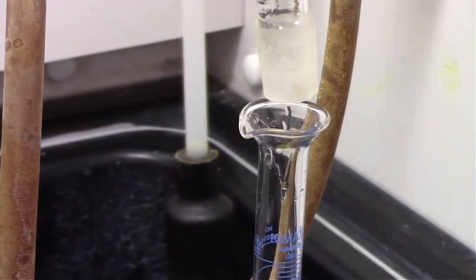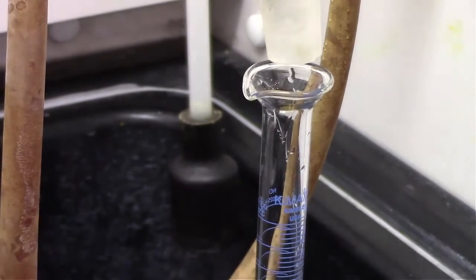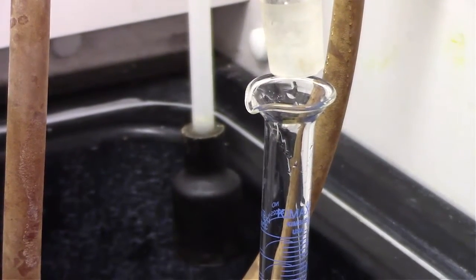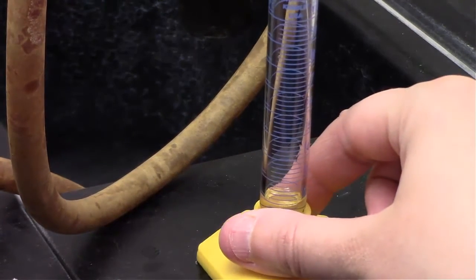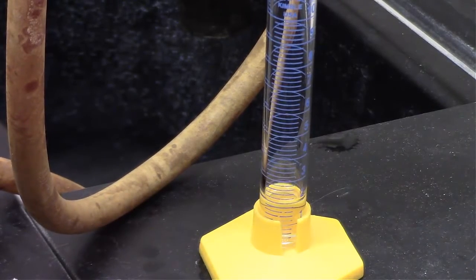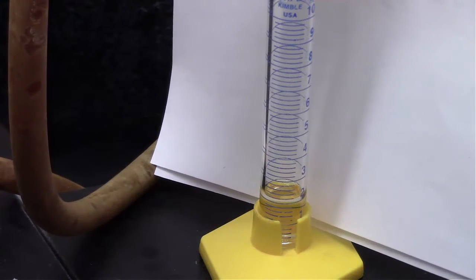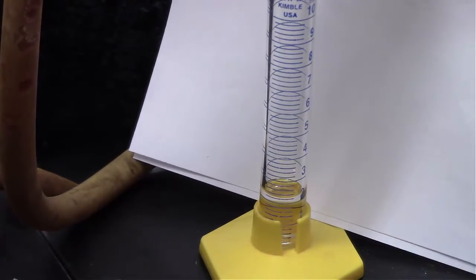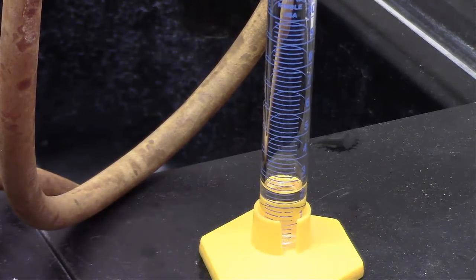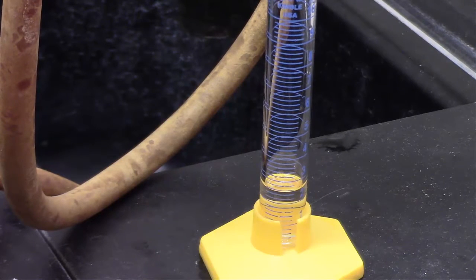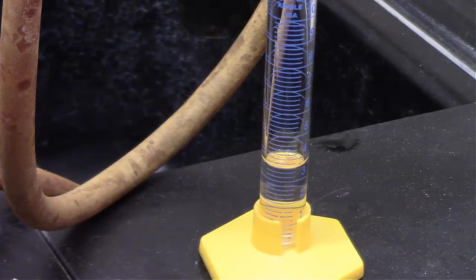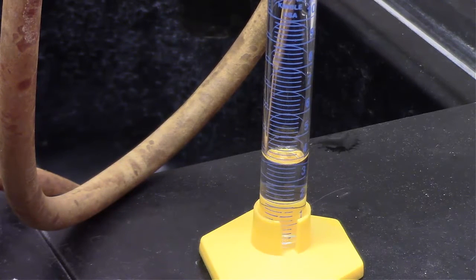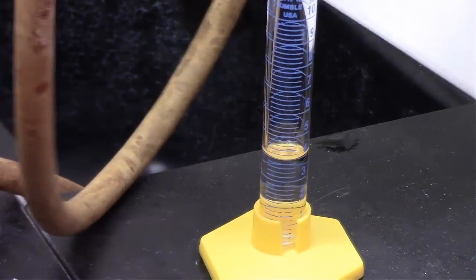Right now we're collecting acetone in our graduated cylinder. The reason why we're collecting there is because on your worksheet you're asked to assess the temperature for every two milliliters collected. So we need a graduated cylinder so we know when we are at the two milliliter mark, and then every two milliliters collected we need to monitor that temperature so we can end up graphing our data.